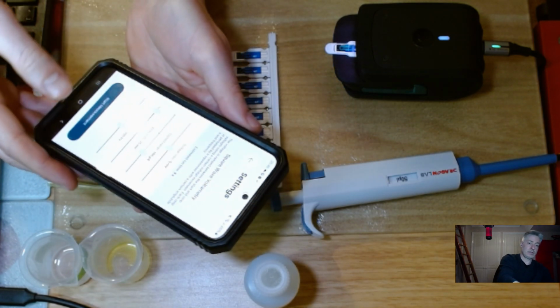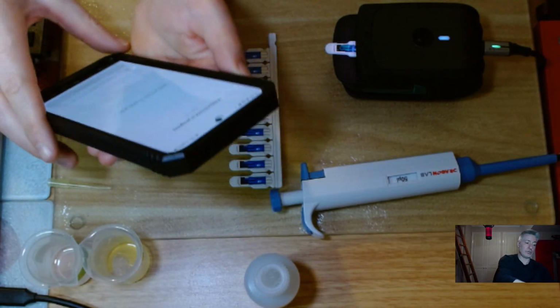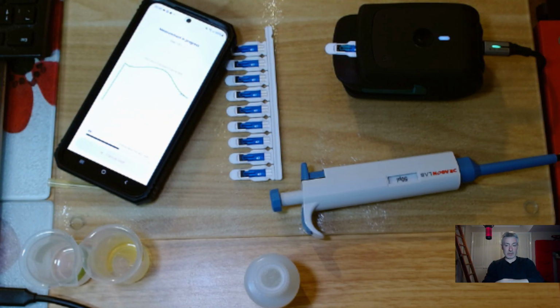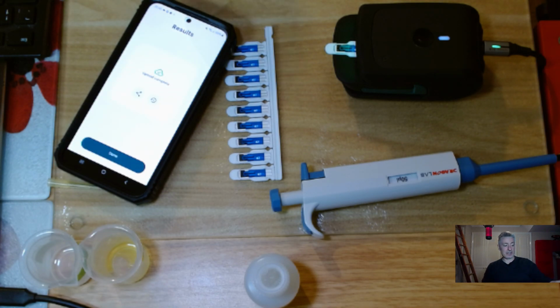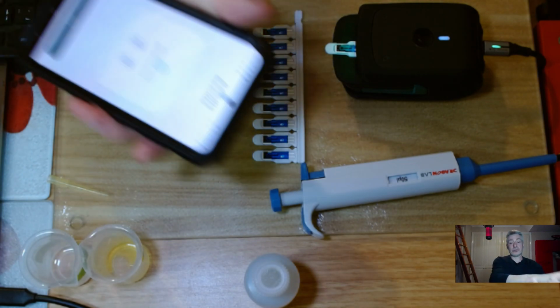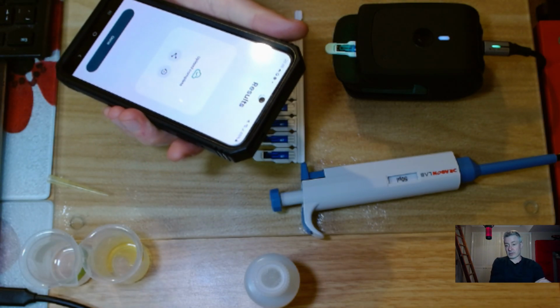Yeah. So I've set that to 100 hertz. Off it goes. Very quick experiment. I do like quick experiments. I say it all the time, but make your assays fast, do your science quickly. If it's not going to work, I'd rather find out quite quickly. And also, if I'm going to develop an assay, I want it to be quite quick.